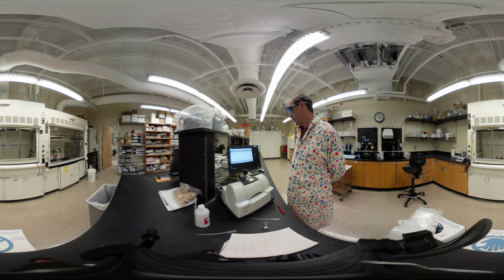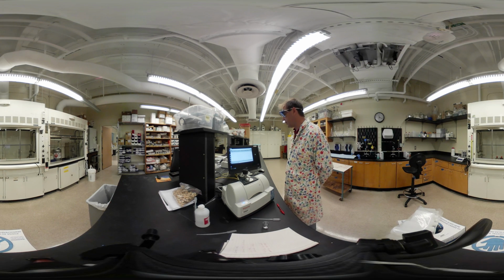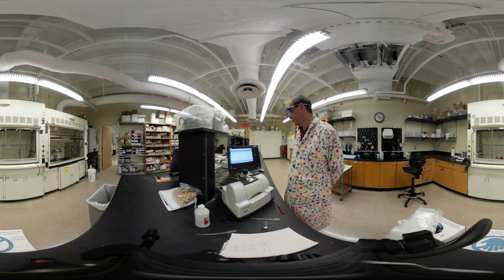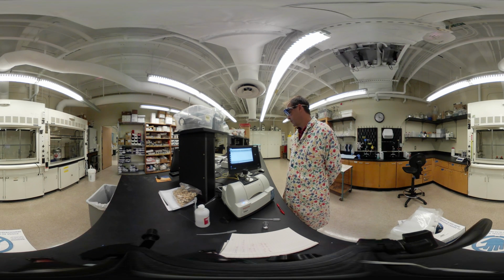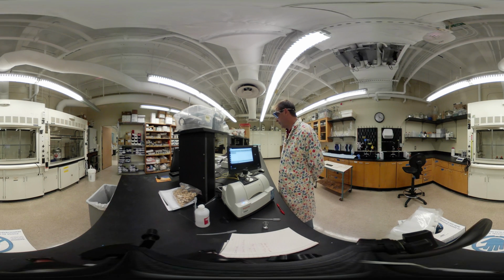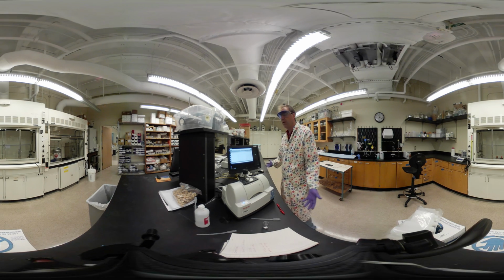Okay. Now it shows you what the spectrum looks like after 4 scans, but it'll take the rest of the 16 to give you better data. Okay, 16 scans. And then we say, yes, we want to look at this and analyze the spectrum. Here is our spectrum. It has a nice feature where you can find peaks. You tell it what height you want it to look for and see how it labels the peaks for you there. Okay, so we'll go ahead and do that. Click replace. And there's our spectrum.